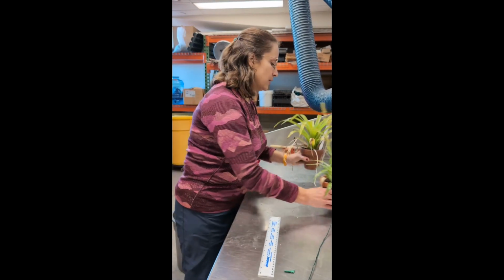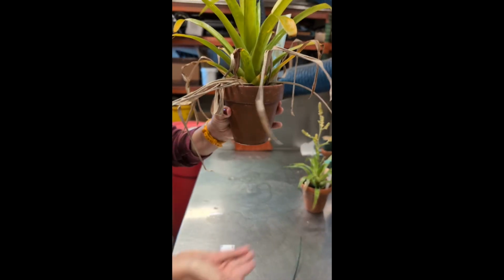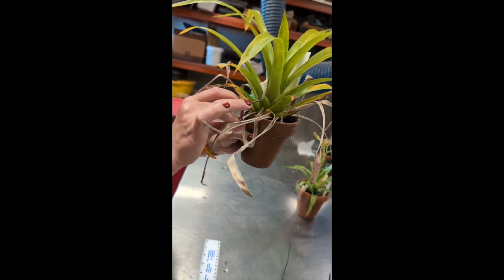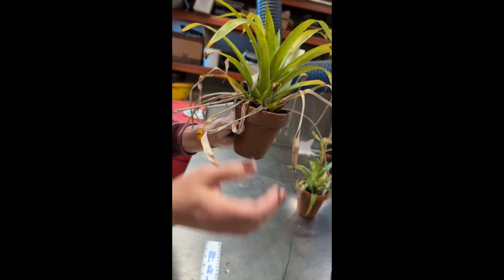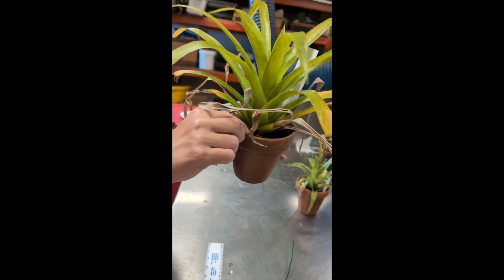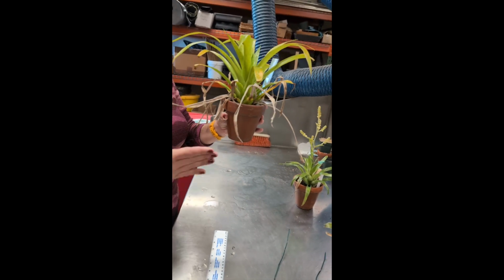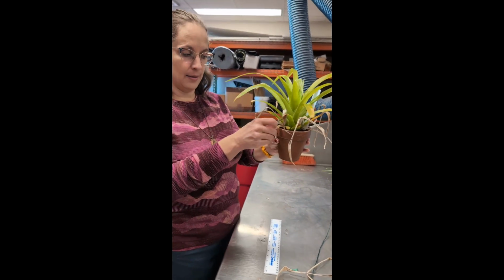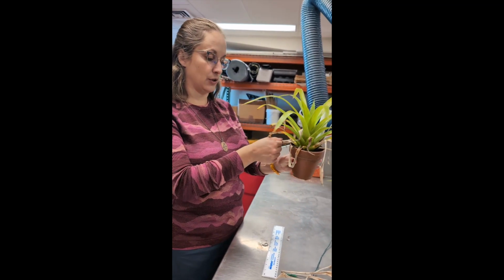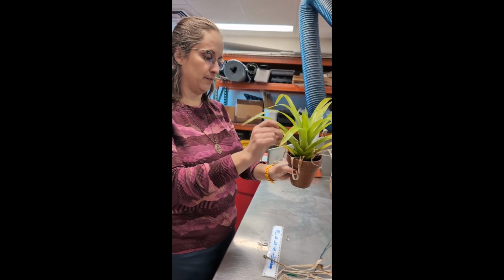Well, here's the thing about bromeliads, right? Some of the oldest leaves, which are furthest down or to the outside, they senesce or die and fall apart. Some of them readily just fall off, like these, and some are in the process of dying. So we need, again, sort of a cutoff of, am I a leaf? Am I a leaf? Etc., etc. So we're saying any green equals leaf.